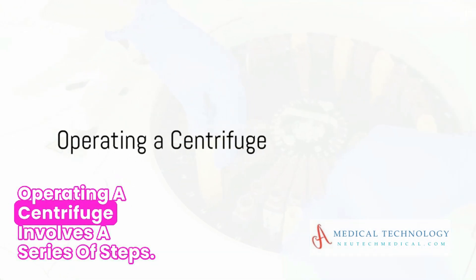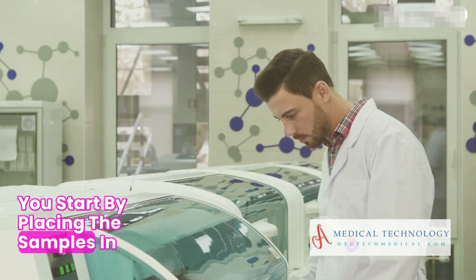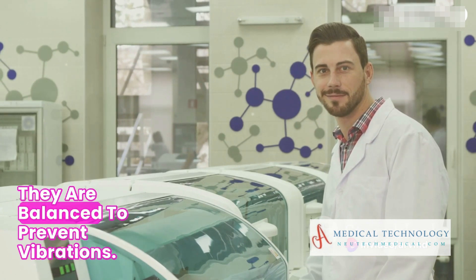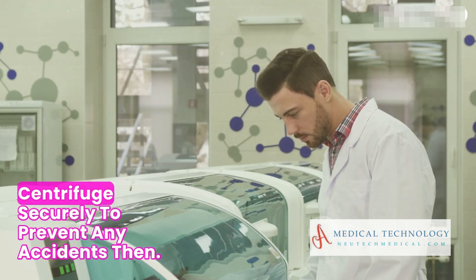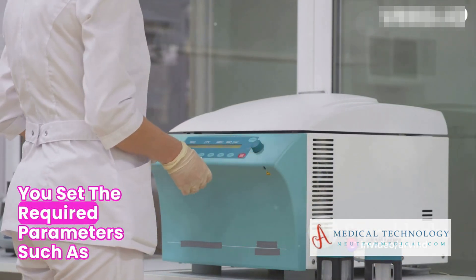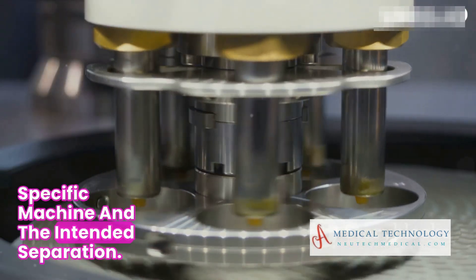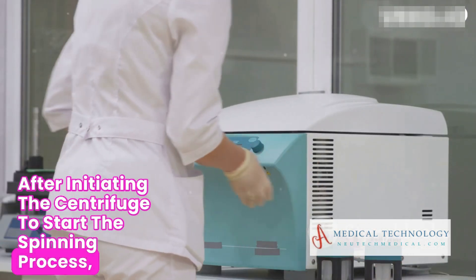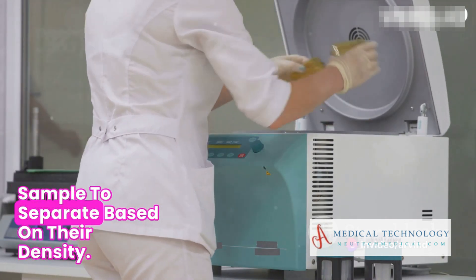Operating a centrifuge involves a series of steps. You start by placing the samples in tubes or containers designed for centrifugation, ensuring they are balanced to prevent vibrations. Next, you close the lid of the centrifuge securely to prevent any accidents. Then, you set the required parameters such as speed, time, and temperature based on the specific machine and the intended separation. After initiating the centrifuge, the high-speed rotation causes the particles in the sample to separate based on their density.